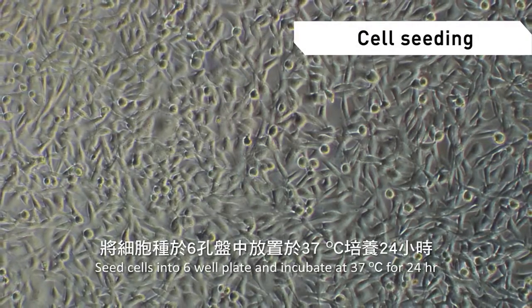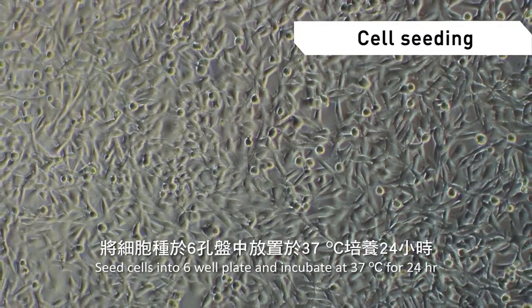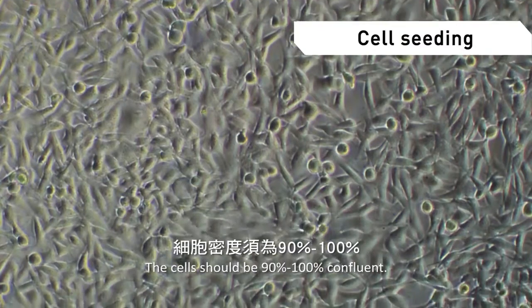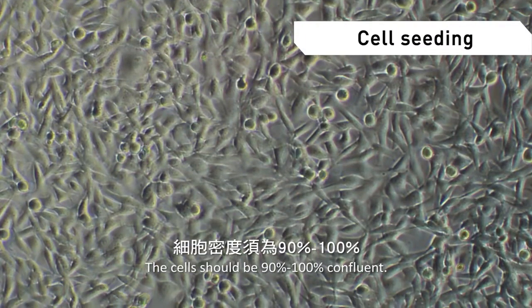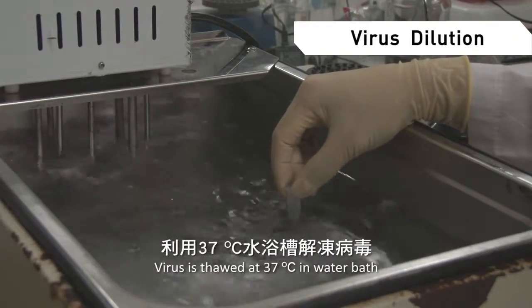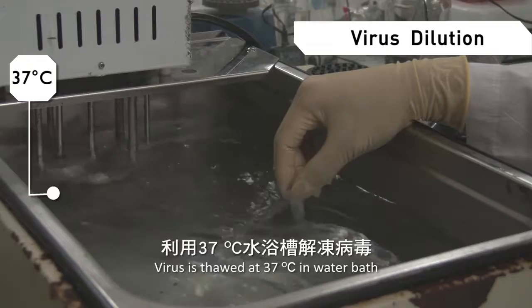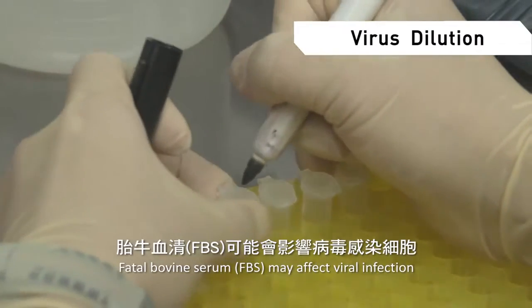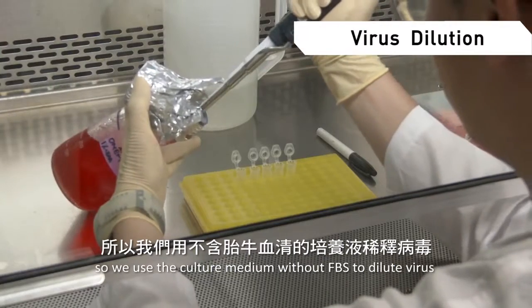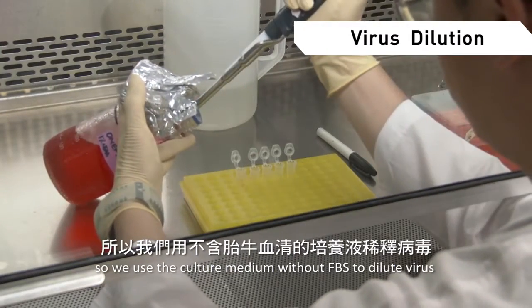Seed cells into a 6-well plate and incubate at 37 degrees Celsius for 24 hours. The cells should be 90% to 100% confluent. The first step is to dilute the virus. Thaw the virus at 37 degrees Celsius in a water bath. Fetal bovine serum, FBS, may affect viral infection, so we use culture medium without FBS to dilute the virus.